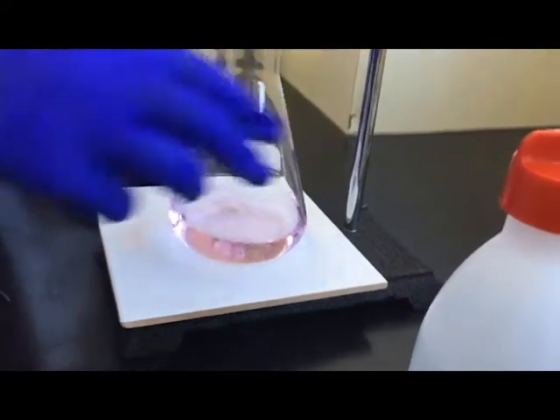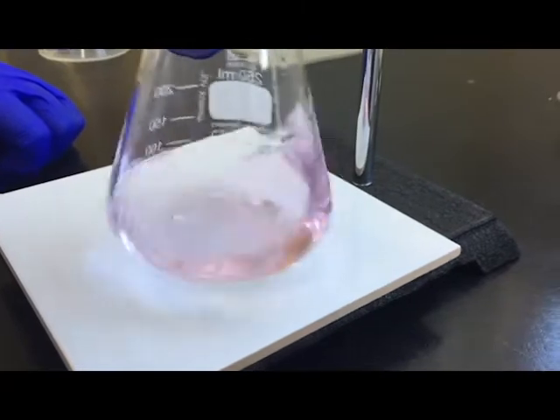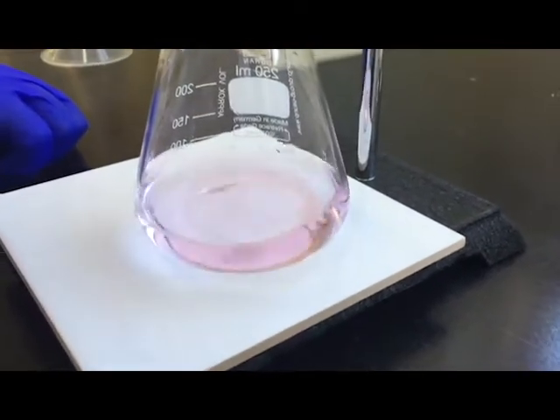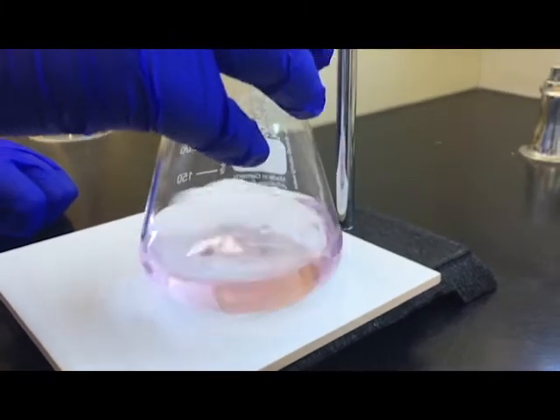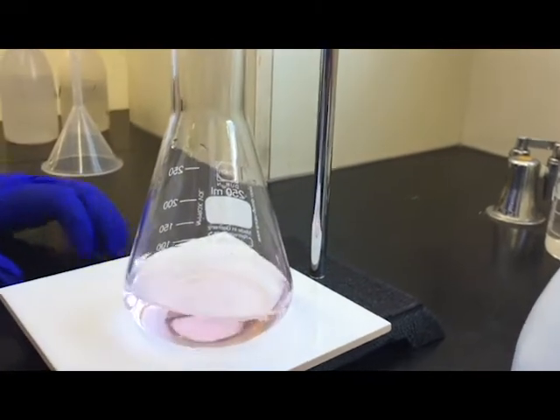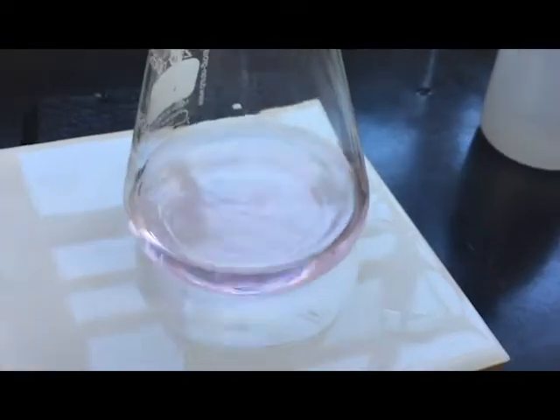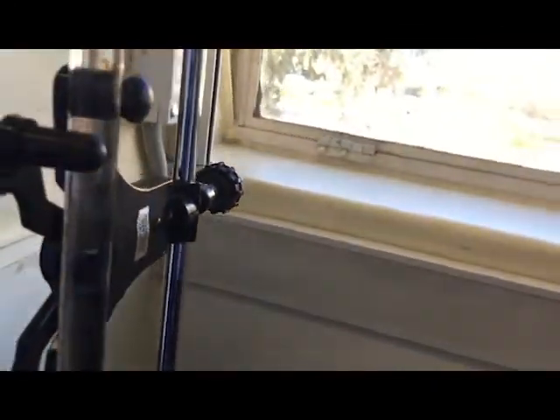And if you keep it on there, see now we've got a nice really pale pink color. I'm gonna let that sit for a few seconds. It's still nice and really pale, it's not disappearing straight away, so I would say that actually is good to go. Let's have a look so you can really see. It's got a bit of a pale pink, and we finished off on about 25.1 approximately.